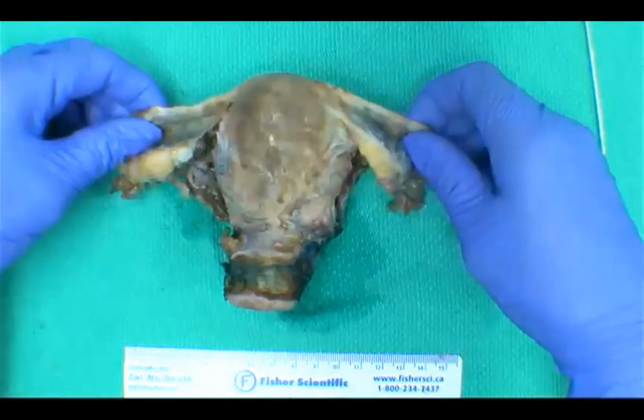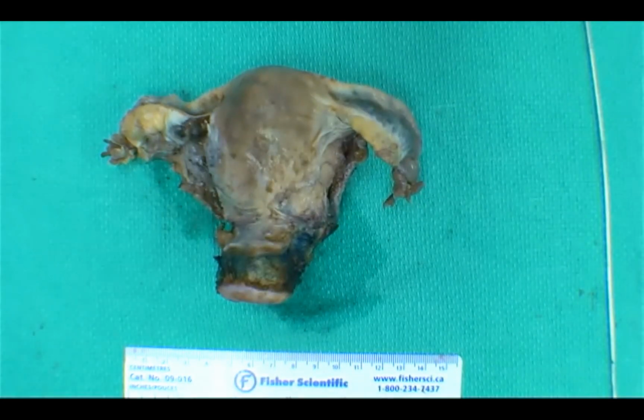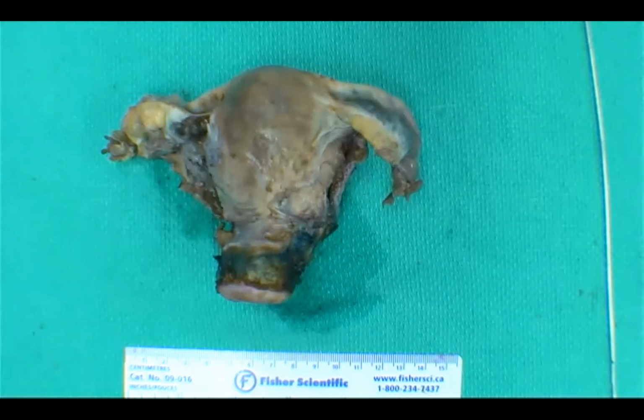We have a question in the chat there. Oh, what do you think? Would you only really section the cervix in cases when you suspect a cervical malignancy? Yes. So if I suspect that there's a cervical malignancy or if the patient has a prior history, or even if she didn't have a prior history and the cervix looks a little bit strange to me, I would just go ahead and radially section the cervix and submit it in toto.